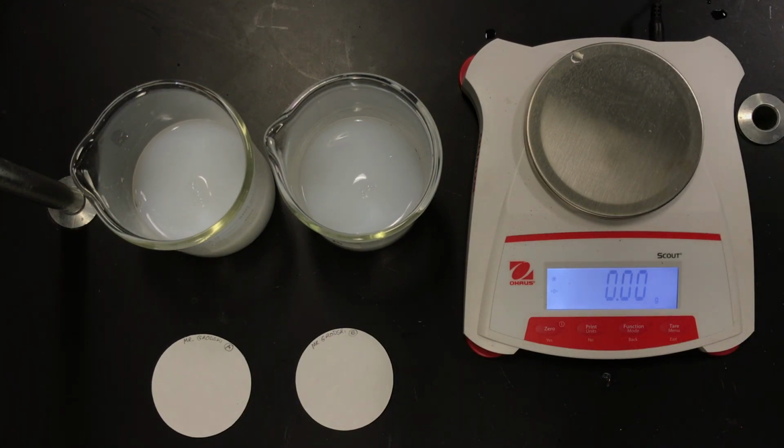So at this point, what we're going to do now is we're going to filter out our precipitate and dry it, because the whole point of the lab is to obtain the mass of the precipitate and thus the moles of the precipitate, and knowing the moles of the precipitate and knowing it's calcium carbonate, I can work backwards to figure out the moles of my initial group 1 carbonate, and that's the key. Once I have the moles of the carbonate with the grams, I can come up with a formula mass. Very good. So let's continue.